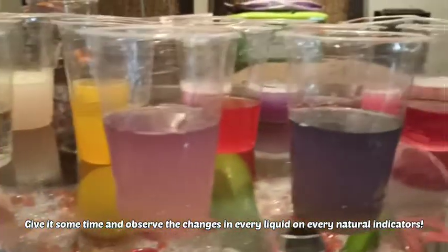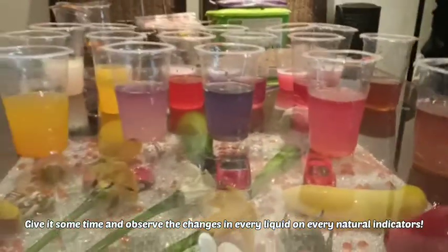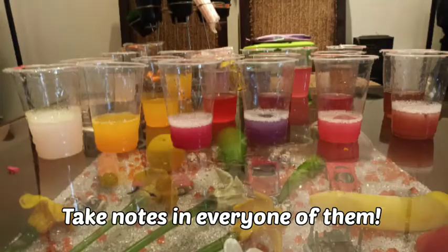Give it some time and observe the changes in every liquid on every natural indicator. Take notes on every one of them.